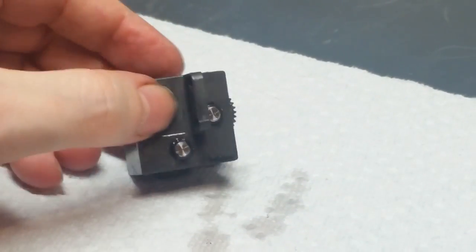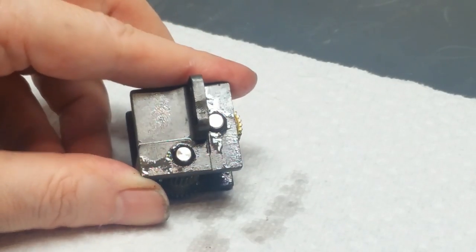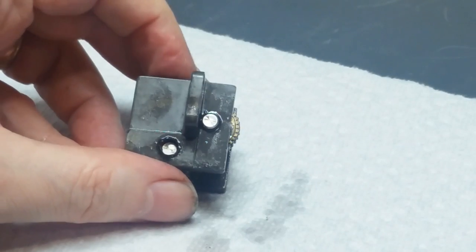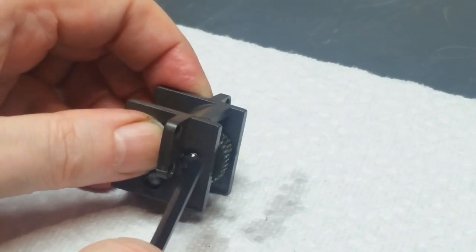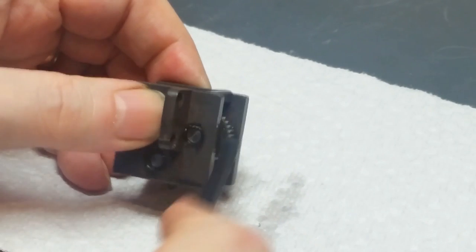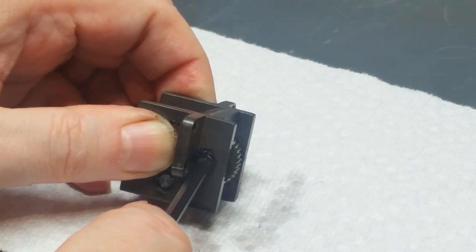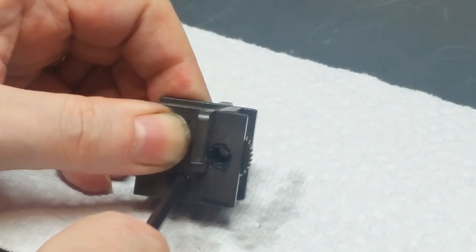We can take a heat gun to it, and then they'll move. Or, hell, if I have to, I can stick it on an arbor press and they'll move that way. Yeah, that one actually moved, so I think we're going to be able to get these out without having to resort to draconian measures. There we go. Don't want to damage the walls of the housing.